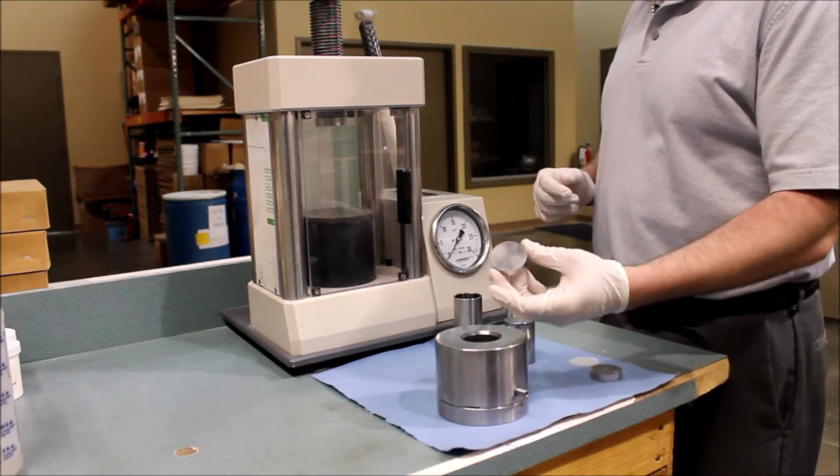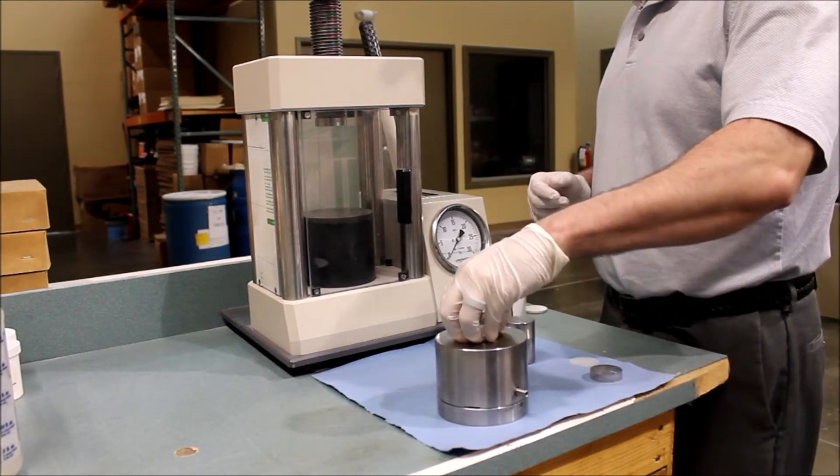Once complete, carefully place one of the pucks onto the bore of the cylinder, taking care not to jam it inside.